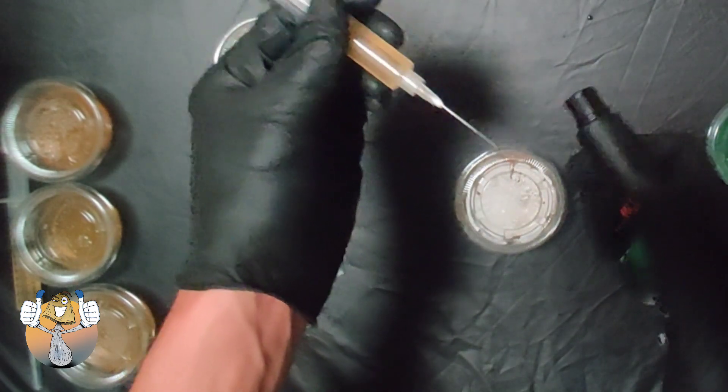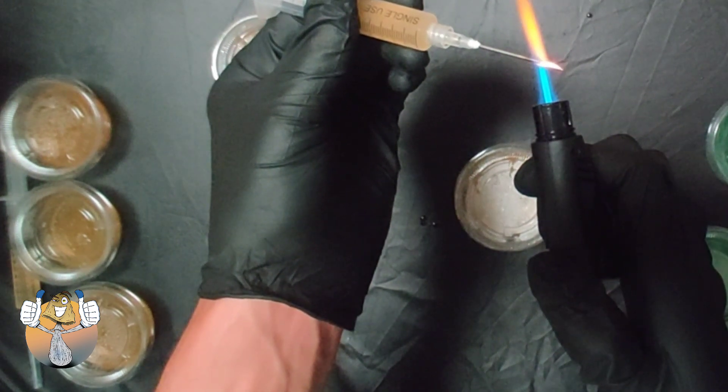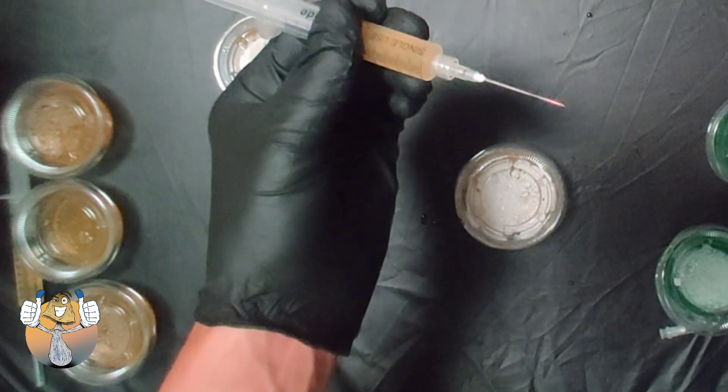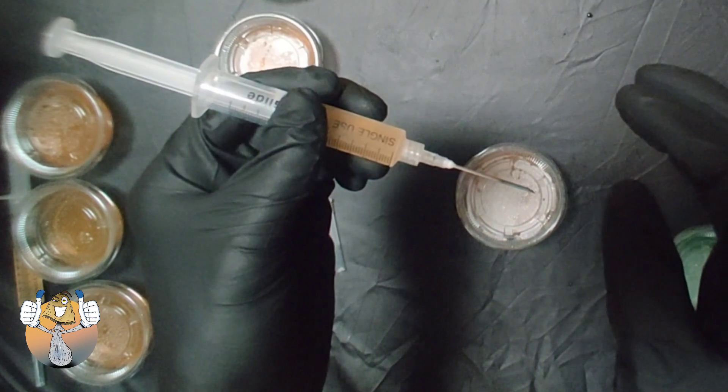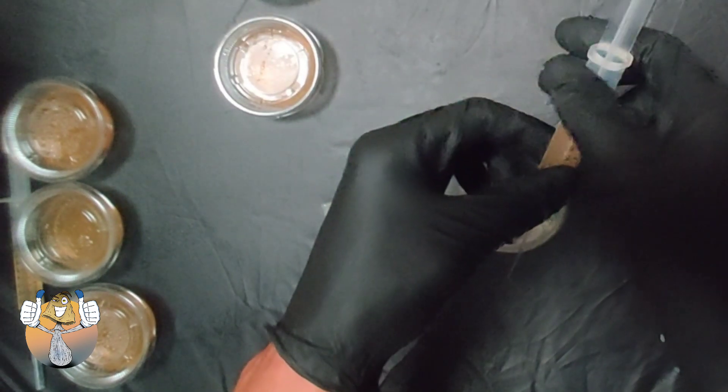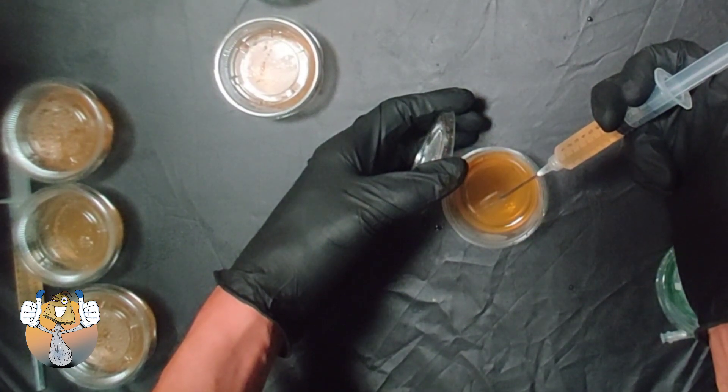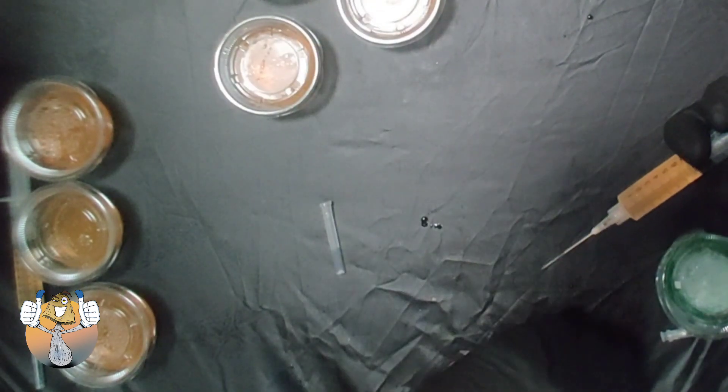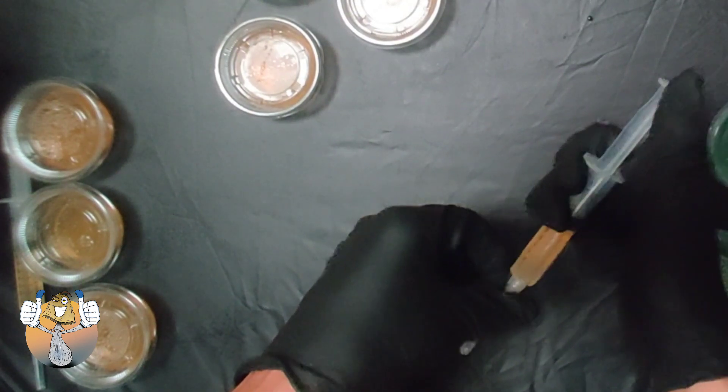Last one for the liquid culture. There we go, nice and red. And we're going to go ahead, let that cool down for a second. Boom, boom, there we go. Close it up, cap your needle, and we're good to go. Let's hit the next one.